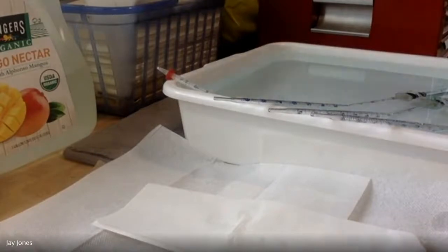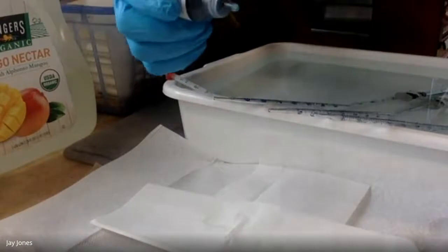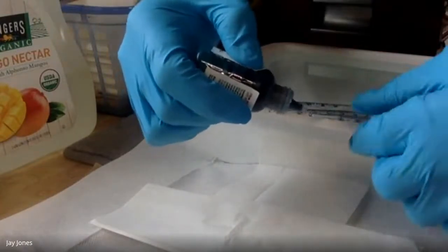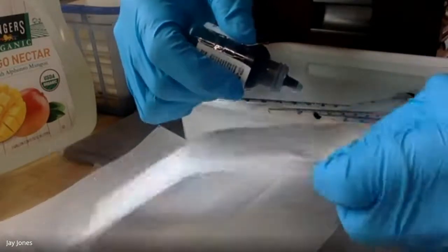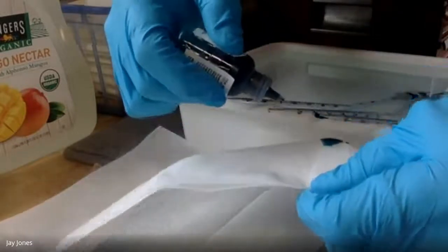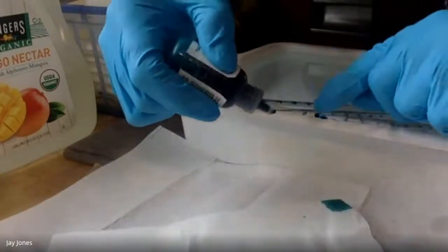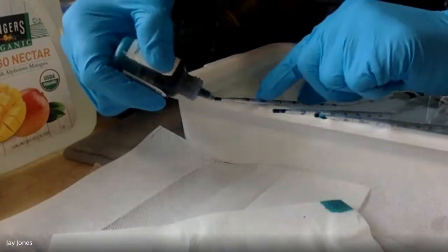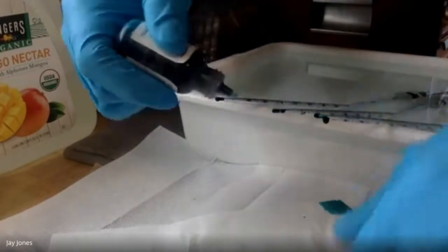My recorder, Shreya, is standing by. I'll tell you when it's time zero, Shreya. Here we go. If I equilibrated it right, the color should get sucked in. Oh, come on. There we go. That went in. Nice, that went in nicely. All right, I'll show you guys in a second.